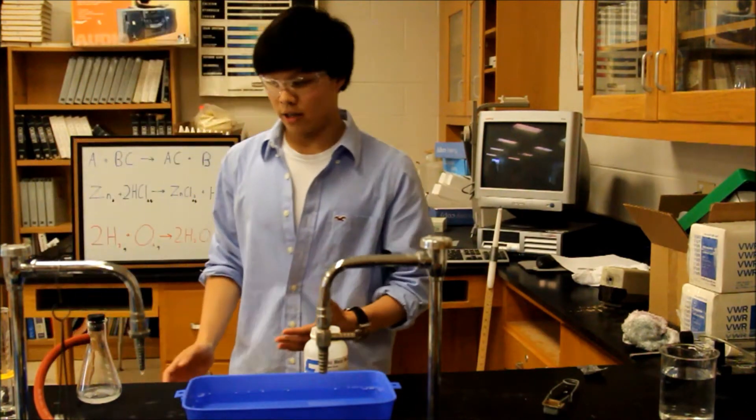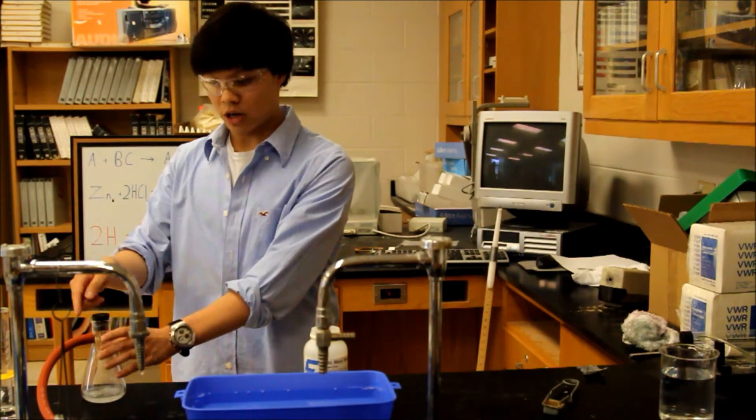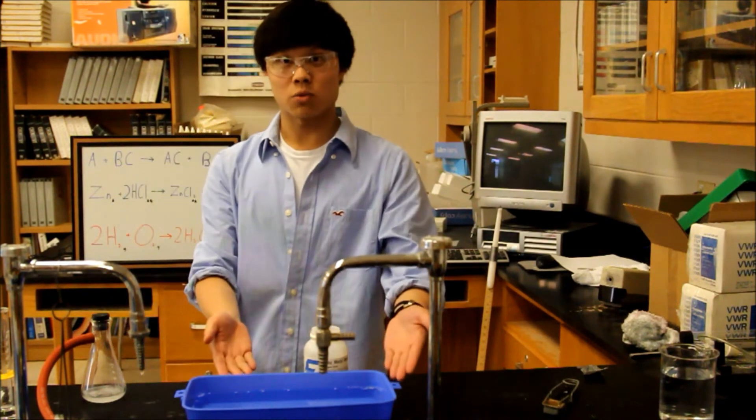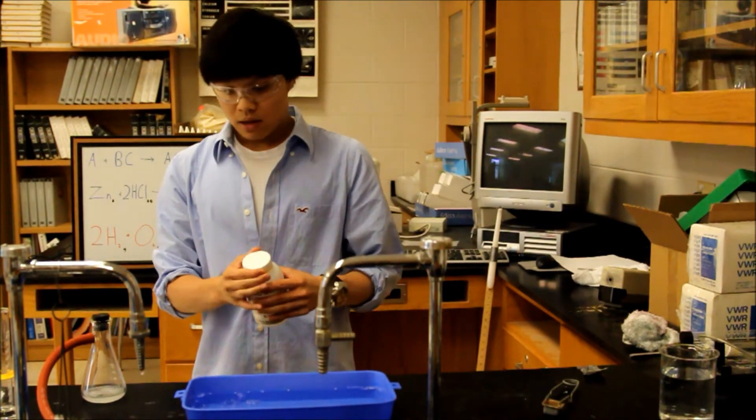What's going on here is that the reaction proceeds inside the flask. The gas that's produced travels down this tube into this water bath, which has water as well as dish soap.